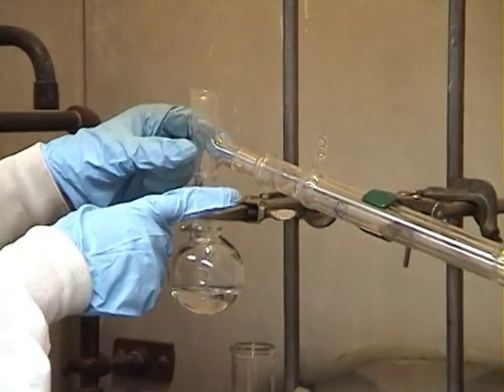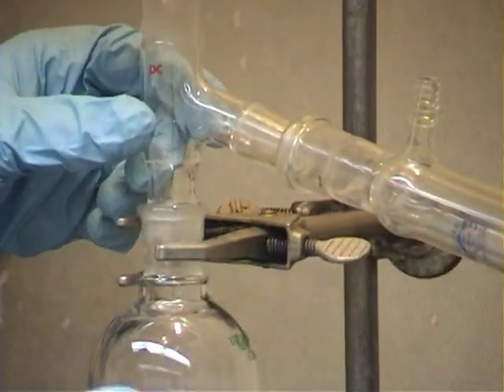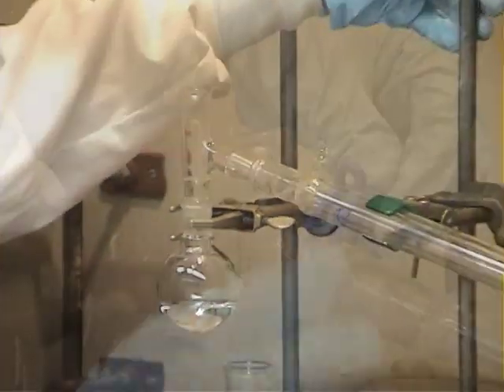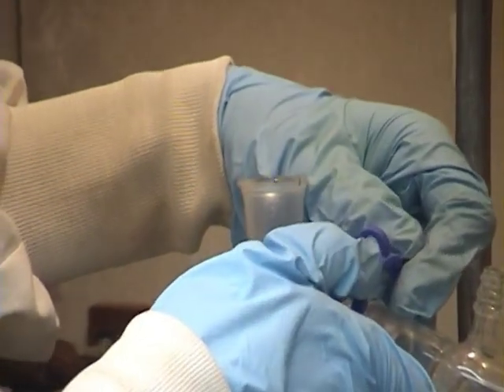Move the ring stands together in order to connect the three-way adapter with the condenser. Secure the connection with a Keck clip.